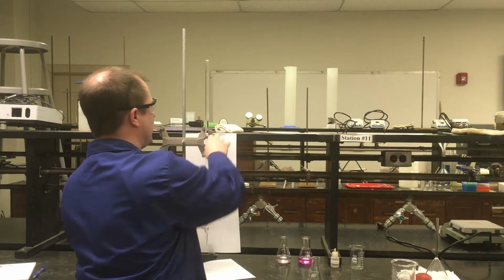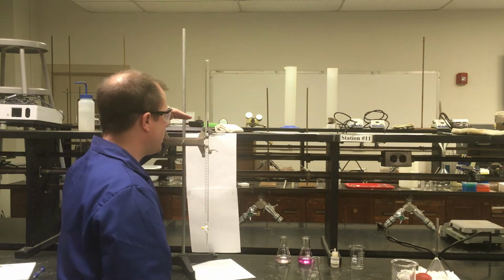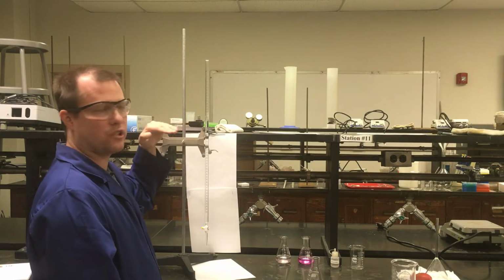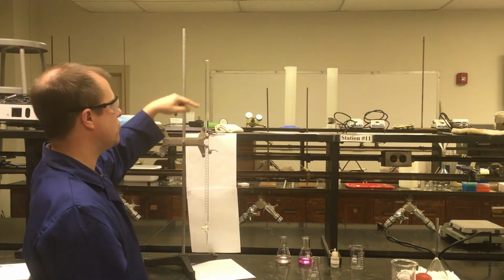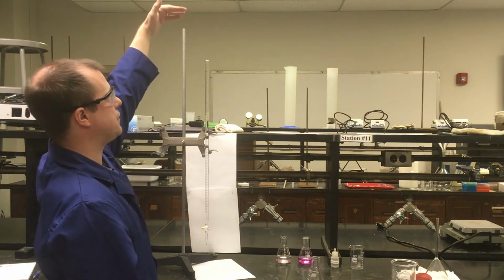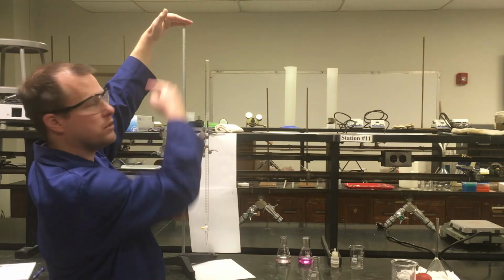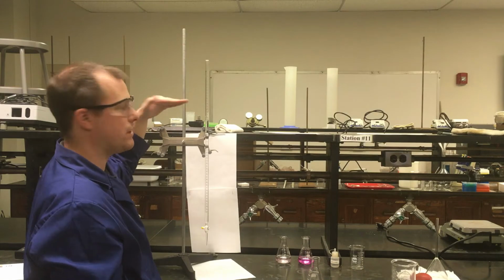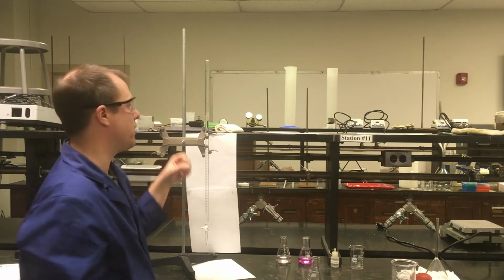And one other thing about when you're making these volume measurements, and you probably saw me bend down as I made the measurement, you want to be pretty much at eye level. If I'm reading a volume that's up here near 0 and I have the thing all the way up here, and I'm looking at it from this angle, I'm not going to be able to make a very accurate reading. Right? So always have it at eye level when you're making your measurements from your burettes.